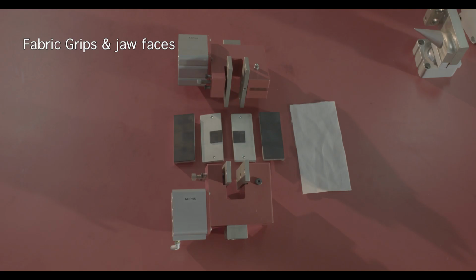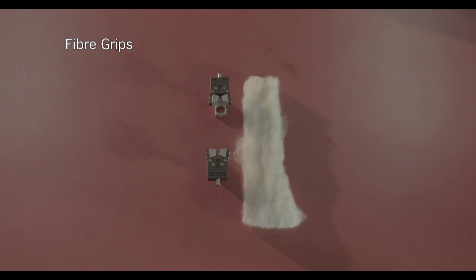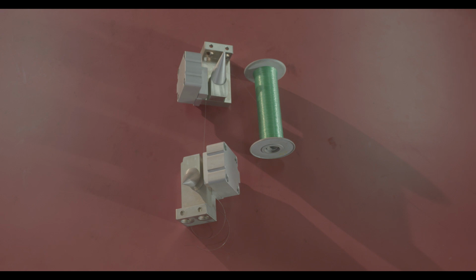Grips. Different grips are available with the instrument for testing various types of textile materials. Different grips are fabric grips and jaw faces. These upper and lower grips and jaw faces are used to measure the tensile behavior of textile fabrics. Fiber grips. These upper and lower grips are used to measure the tensile behavior of textile fibers. Yarn grips. These upper and lower grips are used to measure the tensile behavior of textile yarn.